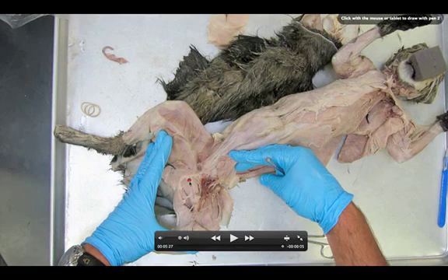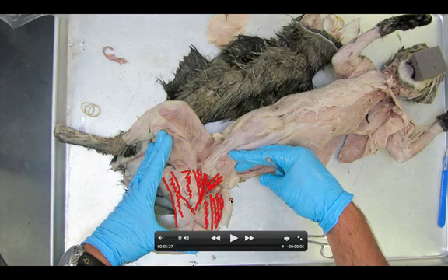That is pretty much the end of the video. Let's take a quick look at all the muscles and make sure we highlight them. So there's the semi-membranosus, adductor femoris, adductor longus, and pectineus. Coming up in this direction we have the iliopsoas, then vastus medialis, rectus femoris, vastus lateralis, and of course the tensor fascia latae. We'll hopefully see you in class to work on this dissection together.